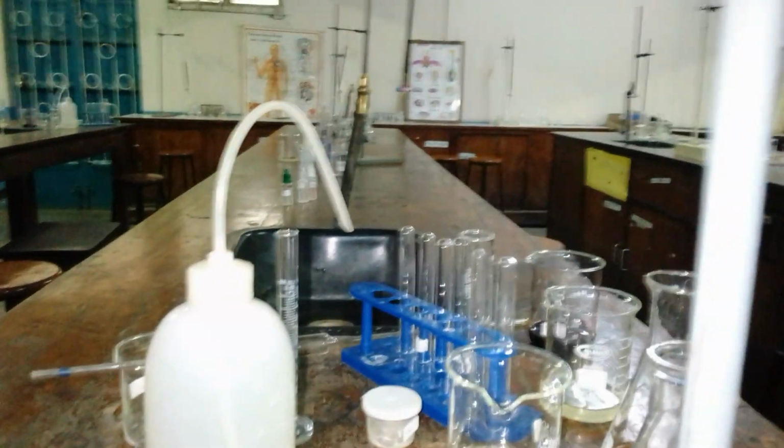The wash bottles here are used to carry distilled water used for qualitative analysis, and the distilled water is only used for qualitative analysis to give accurate and clear results that are supposed to be utilized for conclusion, the presence of certain metal ions like lead ions, magnesium ions, iron 2 ions, copper ions, or, for example, zinc ions. It is just to mention but a few.